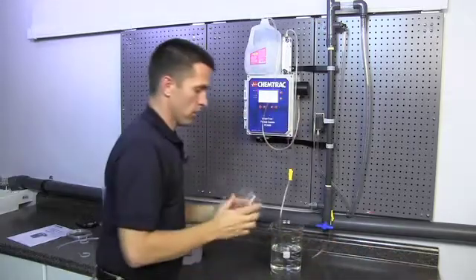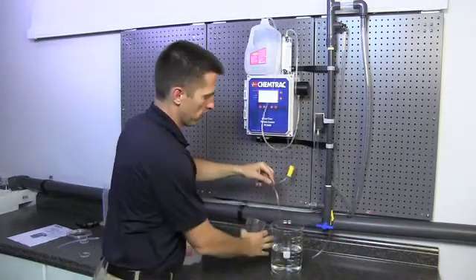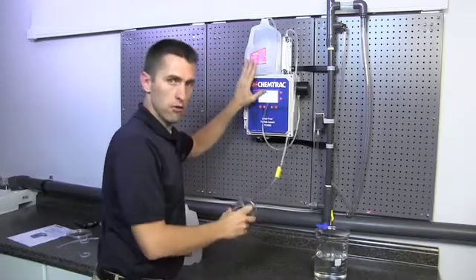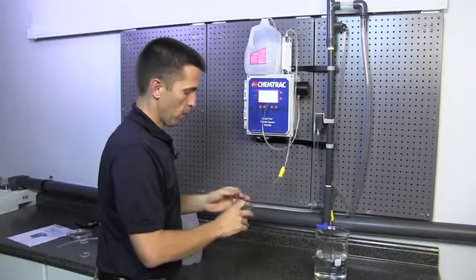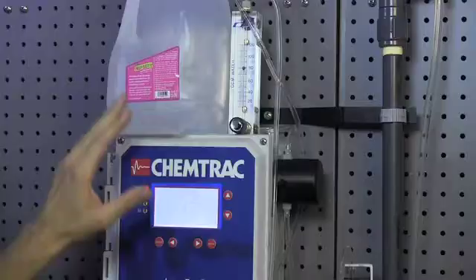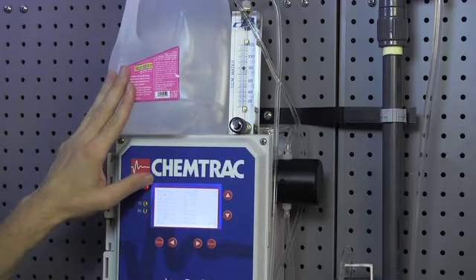The next step we're going to do is we're going to use a new beaker to catch the flow off this jug. What we're wanting to determine is how clean this jug is in terms of how low the particle counts. But we also want to know how much water we extracted from this jug because this jug has approximately 3.785 liters of water in it.